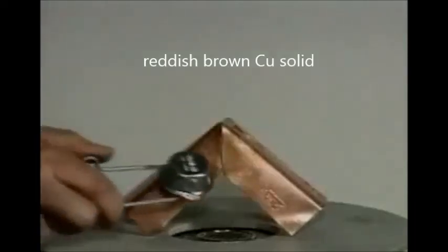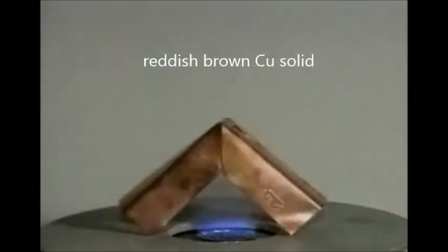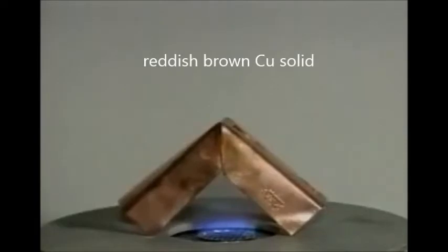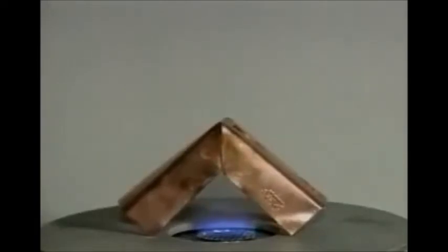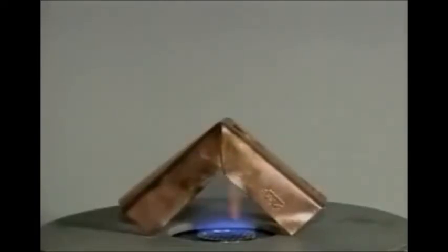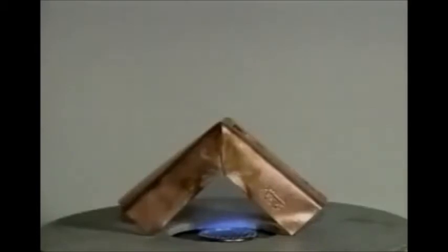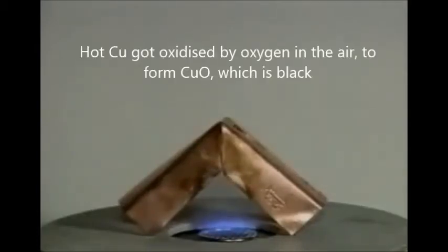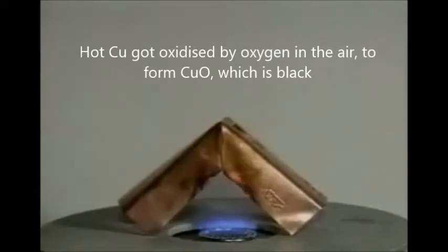A piece of copper is supported over a burner and is heated. The copper begins to react more rapidly with oxygen from the air, and a darker color can be seen on the surface of the copper. This is similar to the color that forms on copper cookware when it is used in a kitchen.